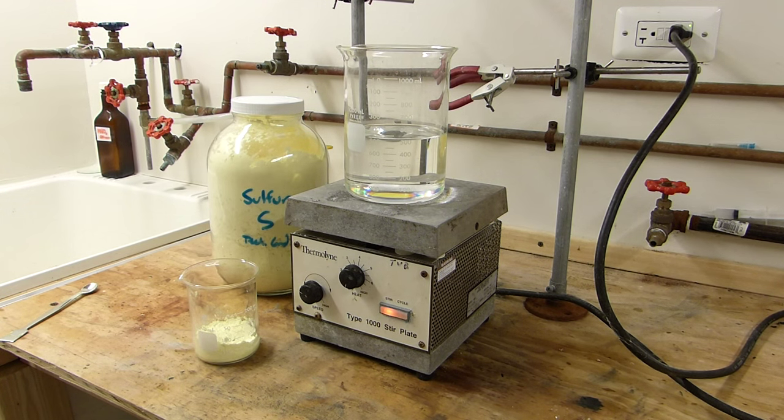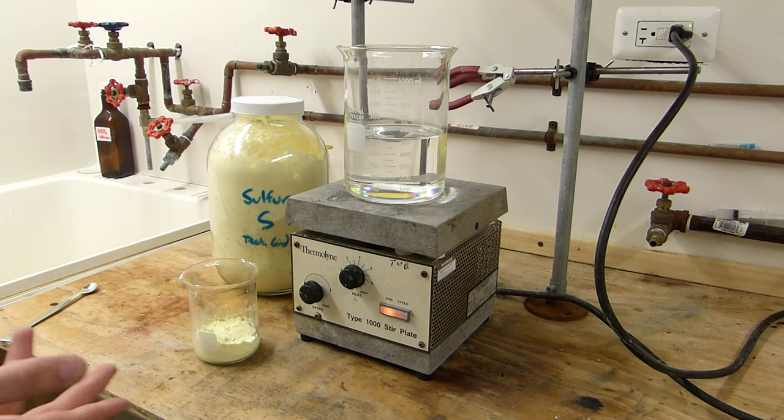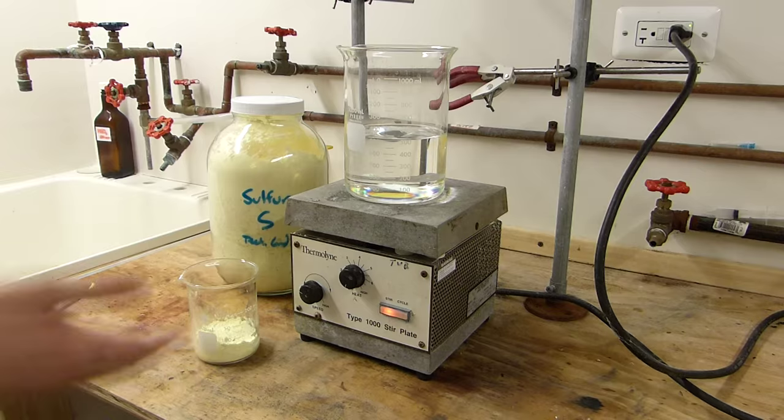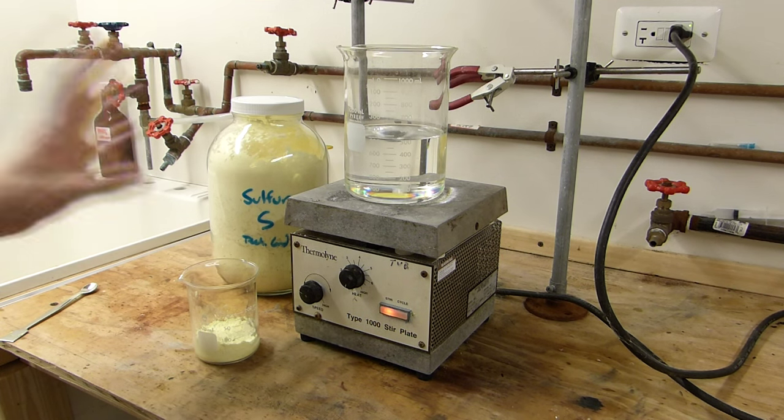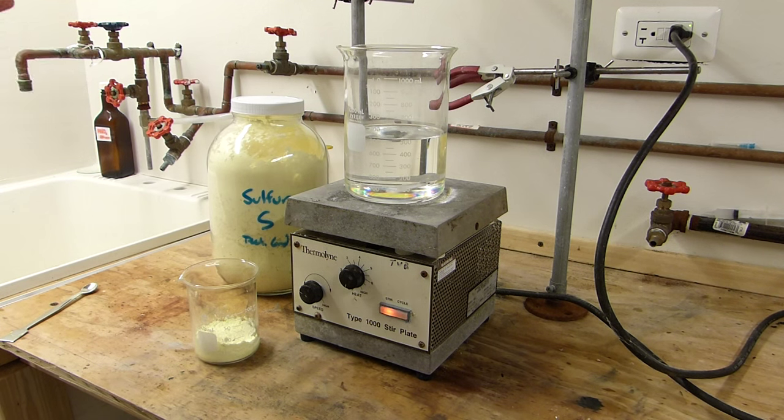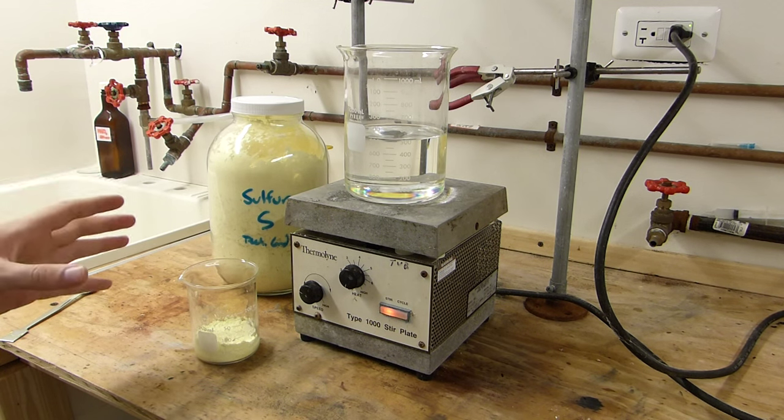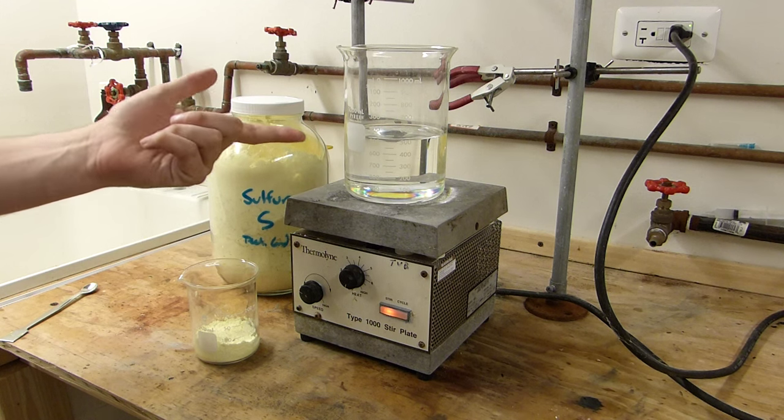A word of safety before doing this. This xylenes, it's essentially gasoline. It behaves very much like gasoline. It's a flammable liquid, it's volatile, it smells, so you have to do this in an efficient fume hood, but not only that, you need to have fire protection methods in place because this is essentially a cup of what will soon be boiling gasoline.